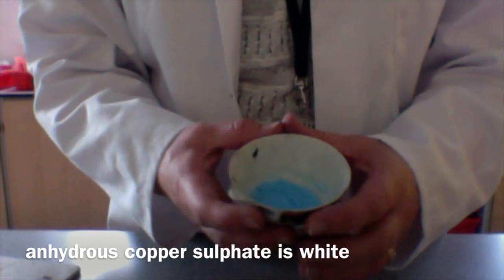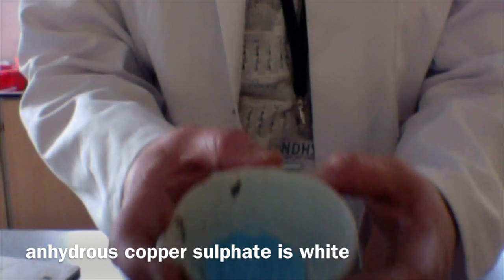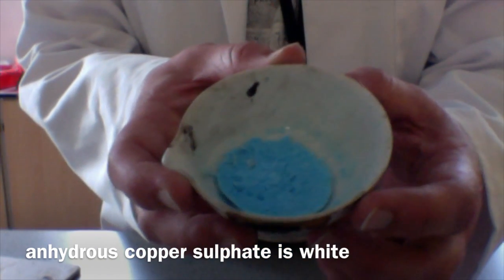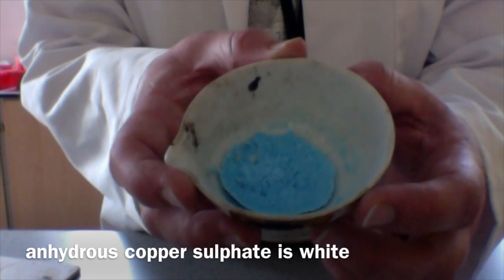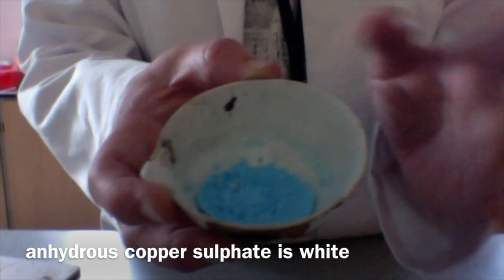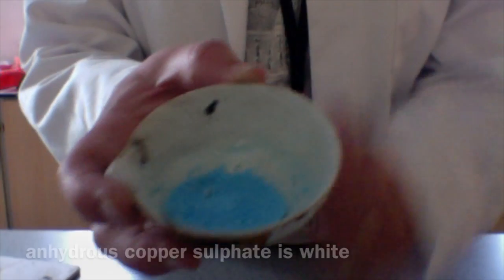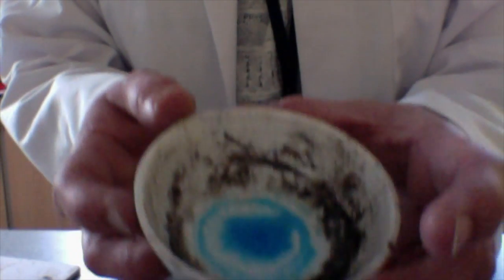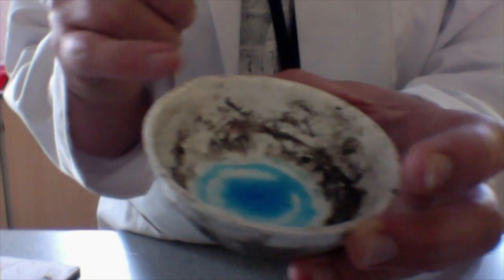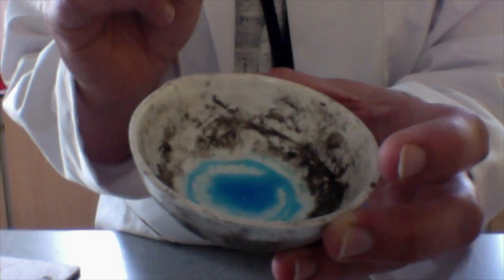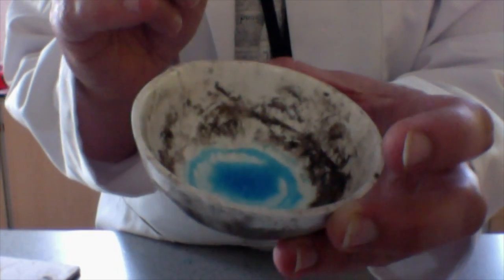And then you leave the rest of it to evaporate just at room temperature. If you drive off the water too quickly, you form an anhydrous salt. So you can see we've got this, eventually that would be a white powder. This one here, you can see that they've driven off the water quite fast around the edge and we're beginning to get the small powdery crystals. But in the centre, we're beginning to form much larger crystals.